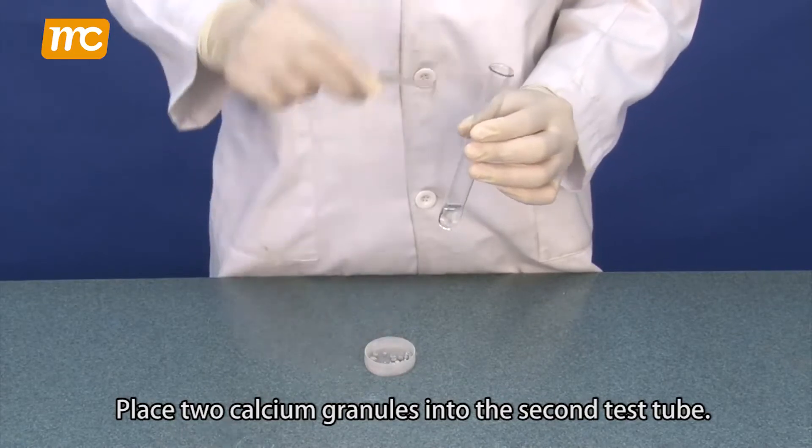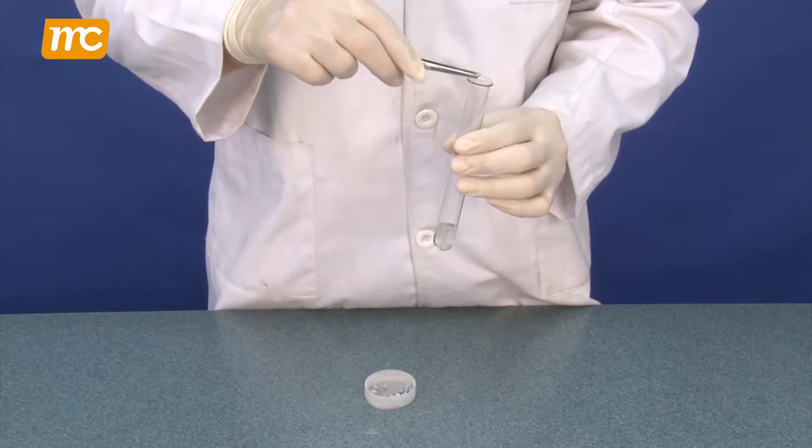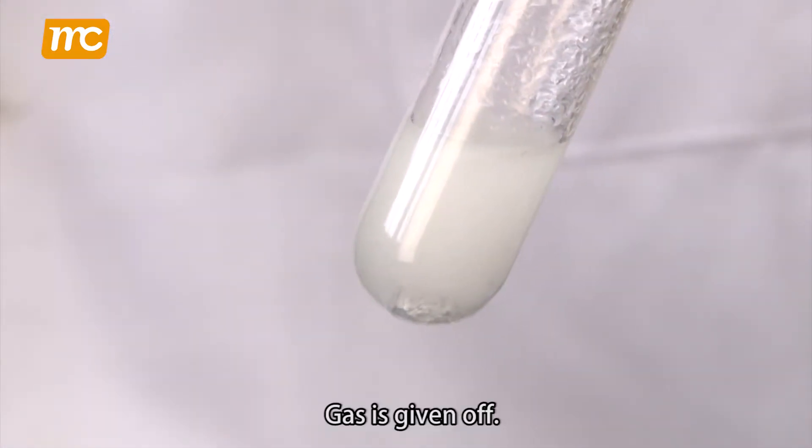Place two calcium granules into the second test tube. Gas is given off.